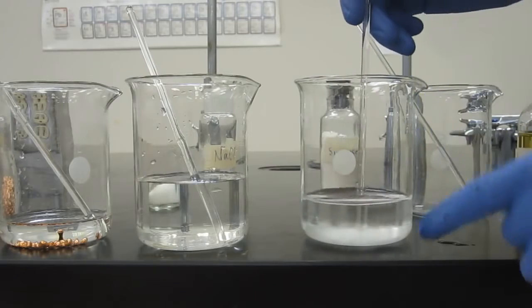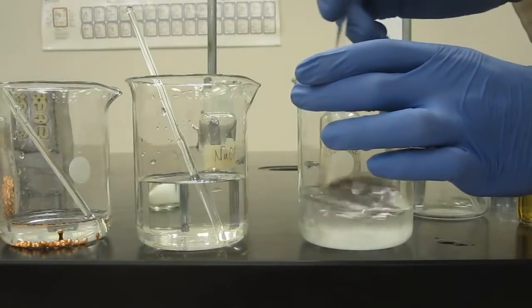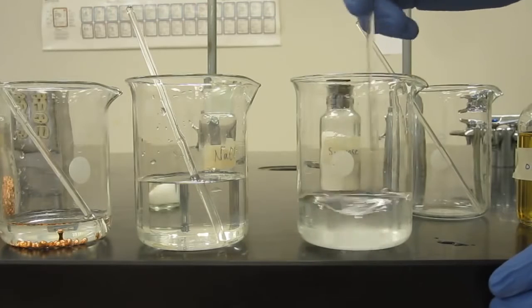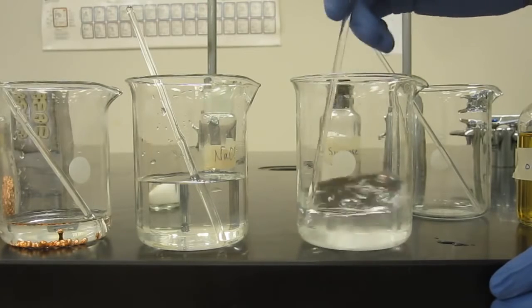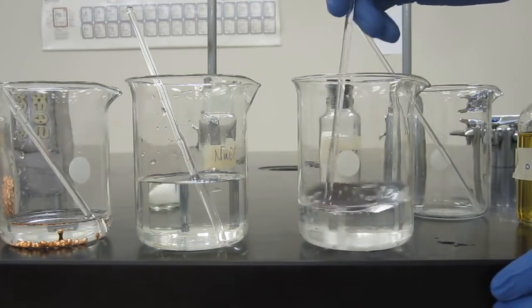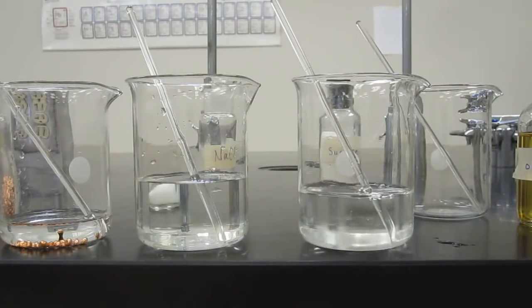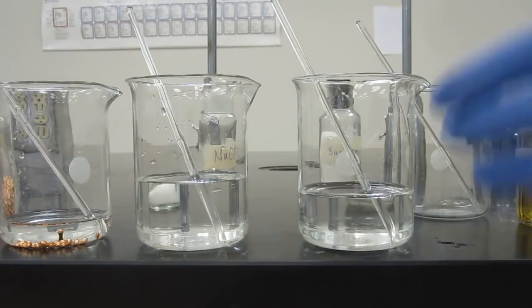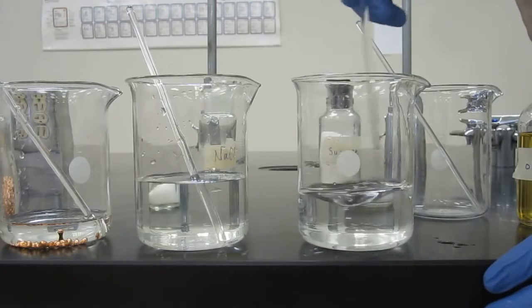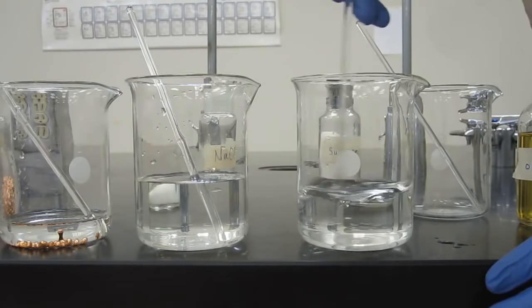So you can see this is a covalent compound, and we'll try to mix it up. So table sugar, I'm sure you guys know what's going to happen. Put a little bit more water in there. So even though the other one was an ionic compound and this is a covalent compound, they still exhibit that same property of being what we call soluble in water.